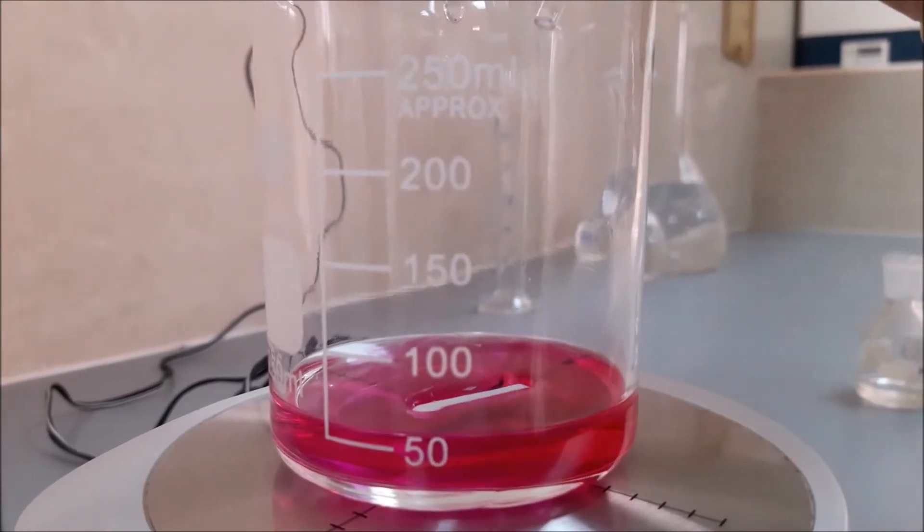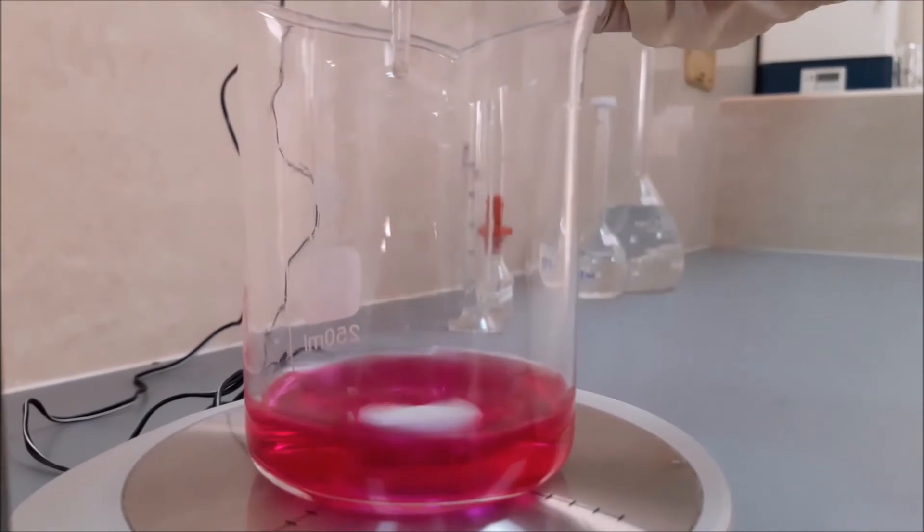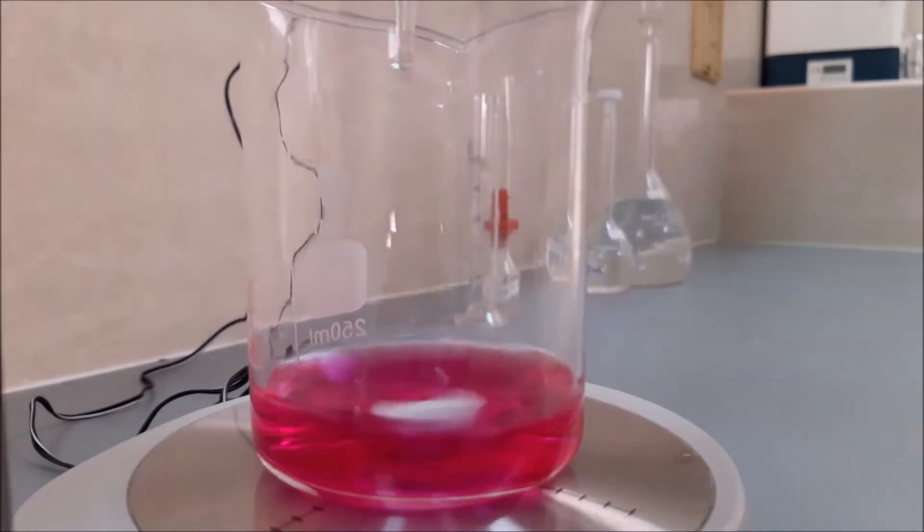So it turns pink. When we do the titration, we will wait until it loses its color. It becomes clear.